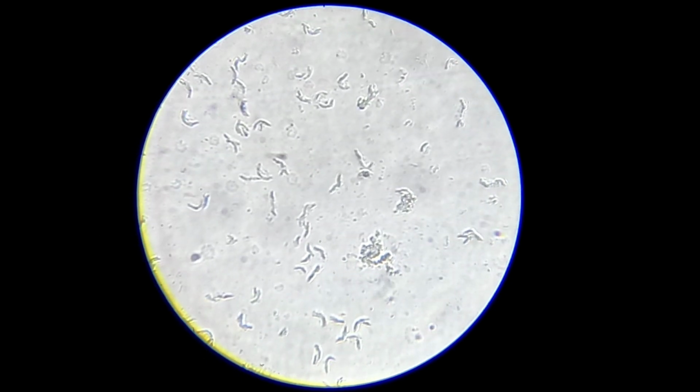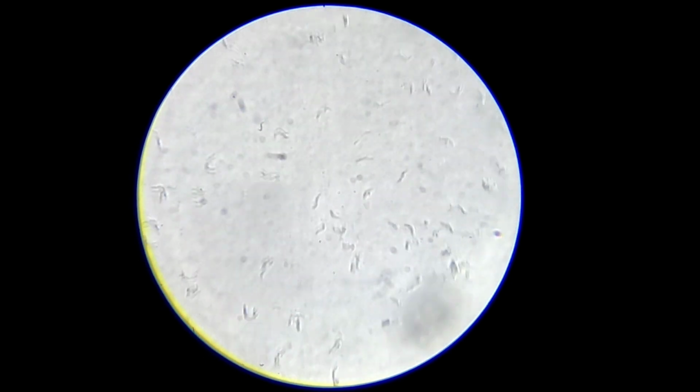Tomorrow I will be adding the first substance into this jar. Let's see how life begins.